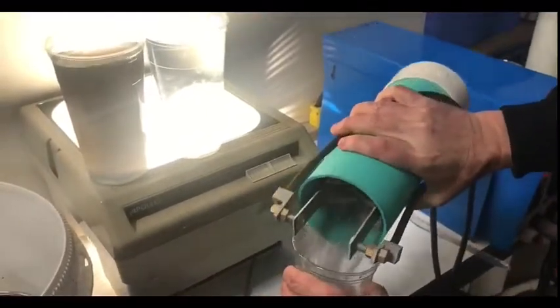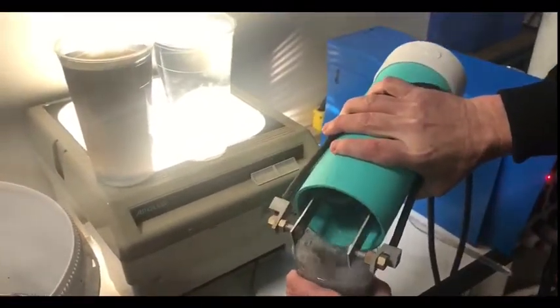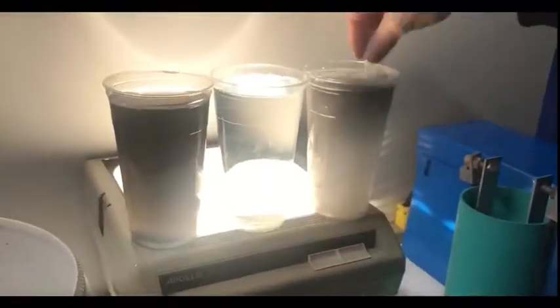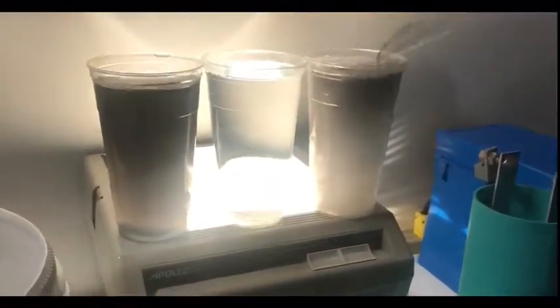Pour that back into the sample cup. Give it a slight stir and you can already see it separating.